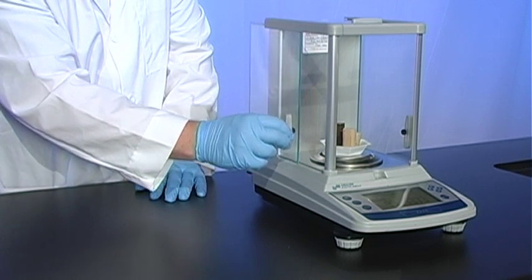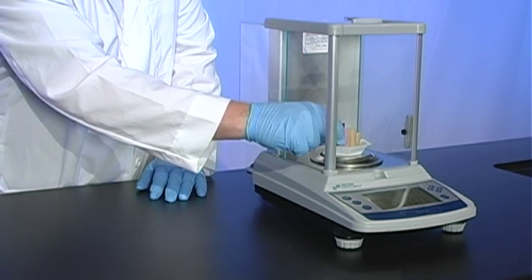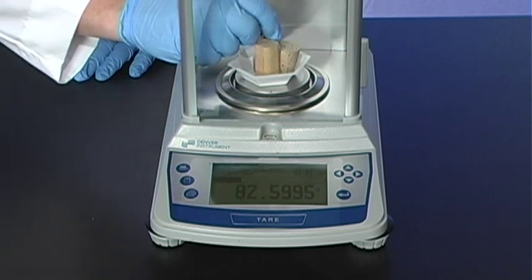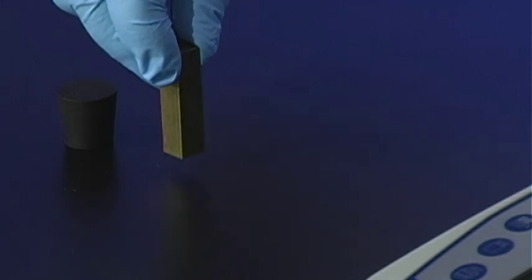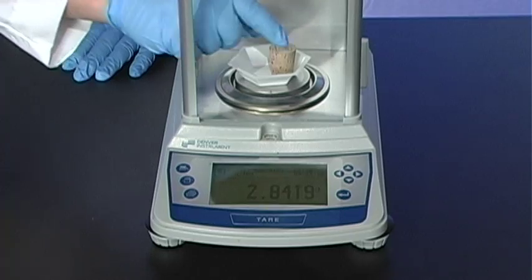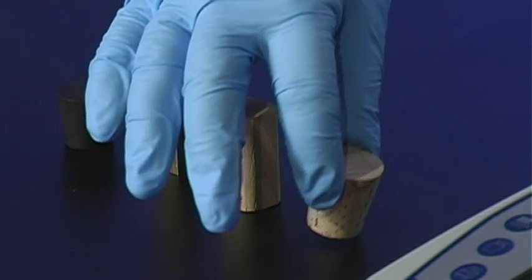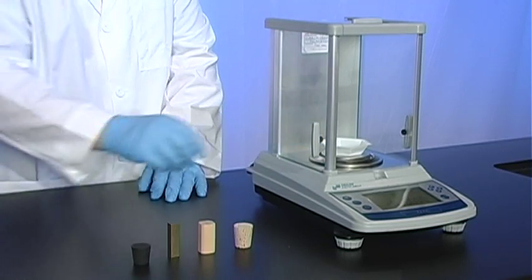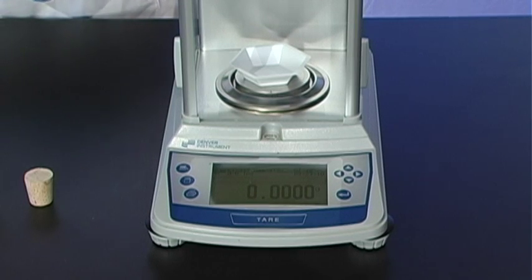Now remove the items, leaving the weigh boat in the balance. Tare the balance again if necessary.